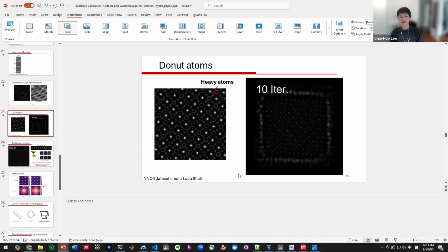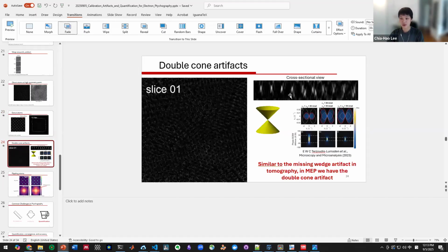Personally, I think it's scientifically interesting to figure out which one's which, but practically I would say the donut is most common. You will see it as a whole column, all donut all the way out. But for the double cone artifacts, for most data sets you don't actually see it because the slice thickness is much thicker. When you have a 1 nanometer slice, you don't see these features because they're much weaker, and you usually get another atom very nearby. So you don't see this unless you're at the very top and bottom slices.